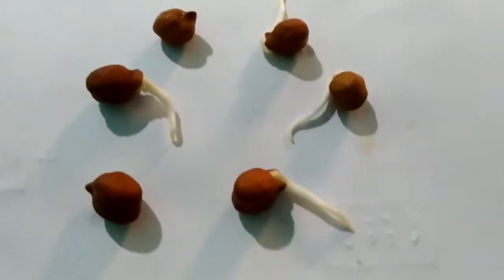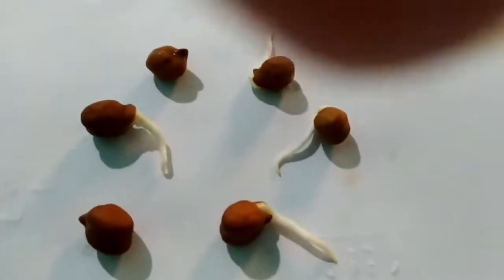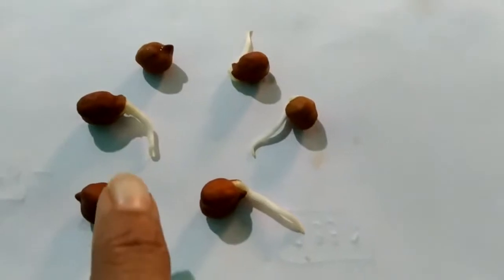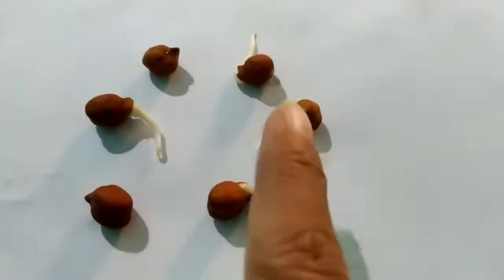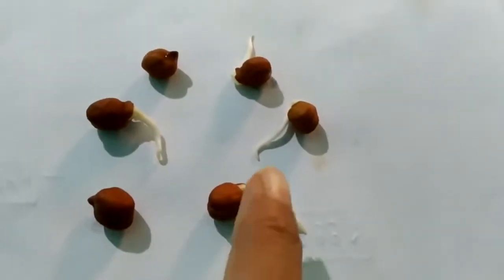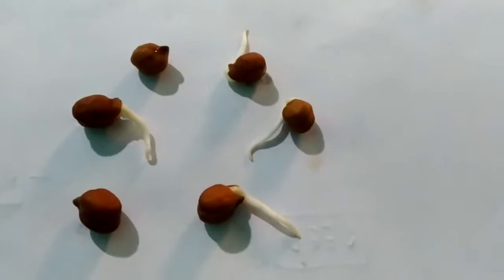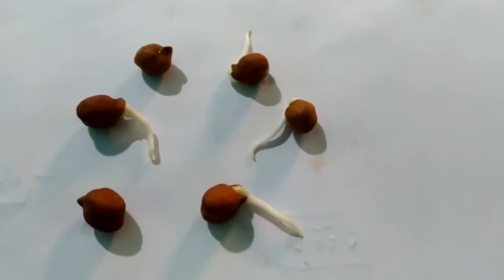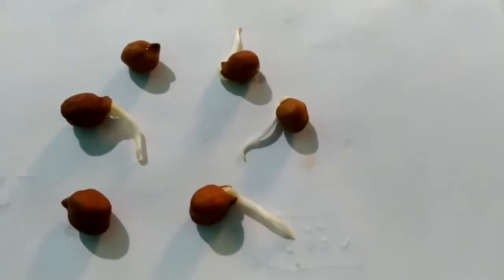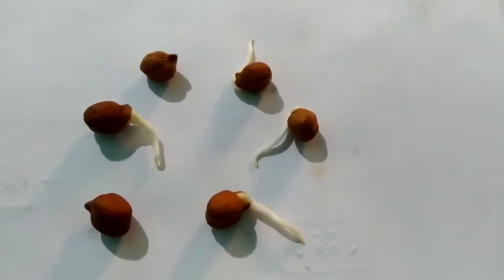Now students, over here as you all can see, I have taken gram seed in its various germinating conditions so that I can show you the dissected part of this gram seed. So let me begin.